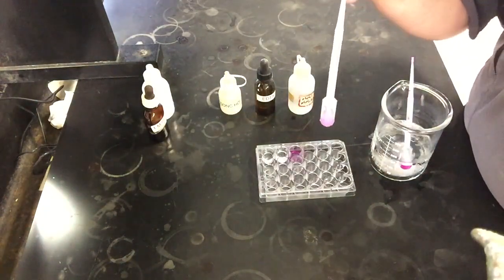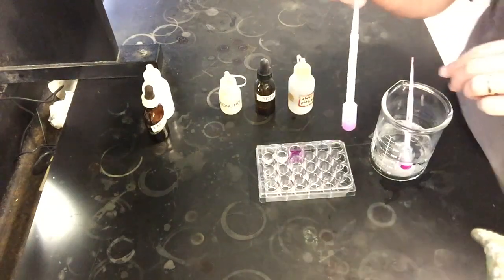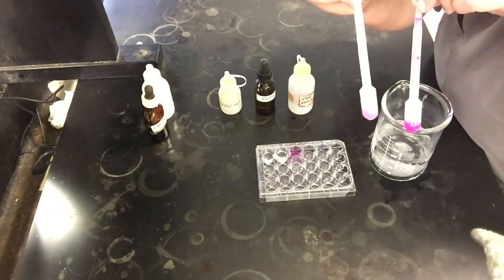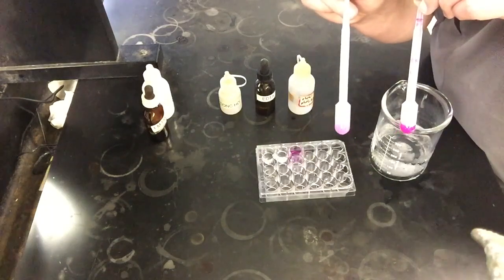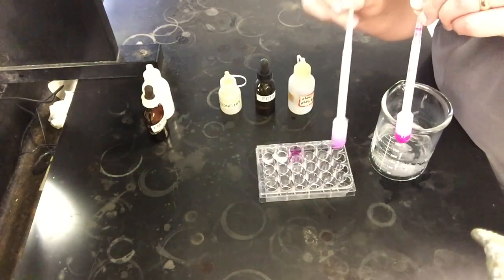All right, so I'm back now after having heated this for a good bit. And as a way to give a good comparison, I've also tried cooling one down at the same time, the same kind of mixture. And I think this gives a better visual comparison. The one I'm holding here, this was the one that was in the hot water bath. It's a much lighter color, which indicates that there's much less hydroxide here.